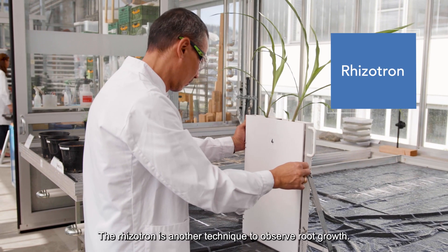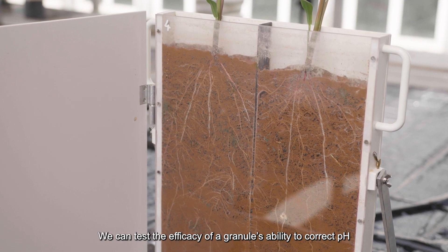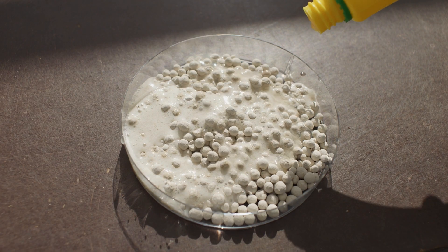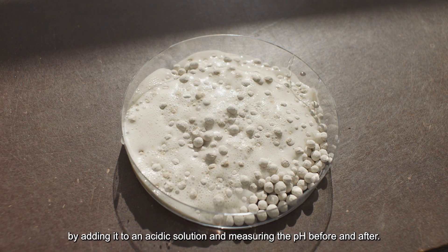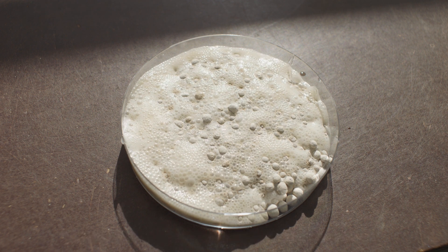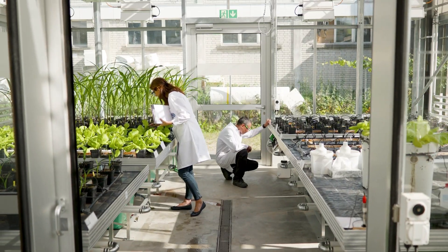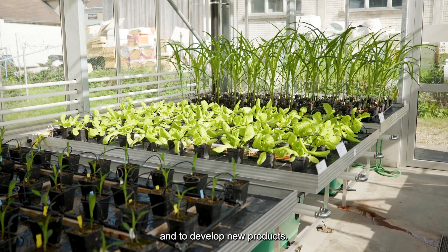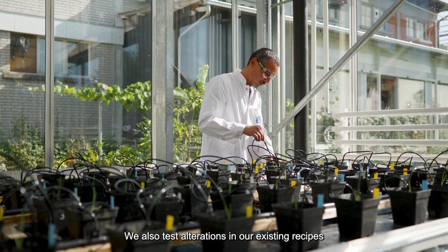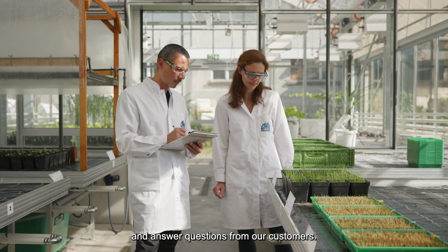The Rhizotron is another technique to observe root growth. We can test the efficacy of a granule's ability to correct pH by adding it to an acidic solution and measuring the pH before and after. We have this technical center here to test our products, develop new products, test alterations in our existing recipes, and answer questions from our customers.